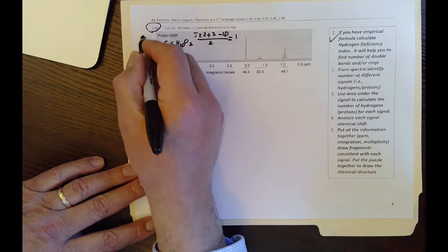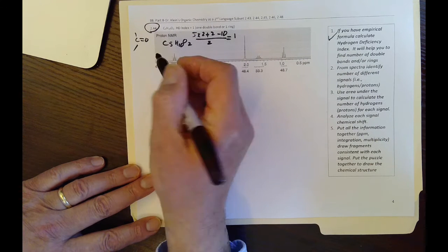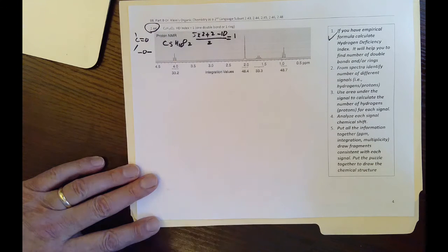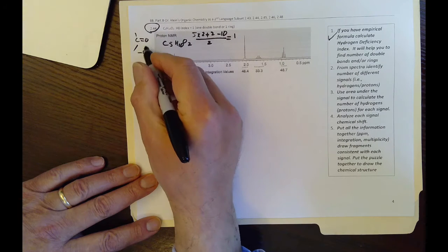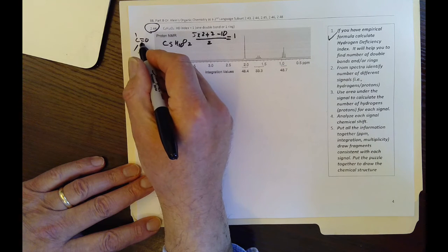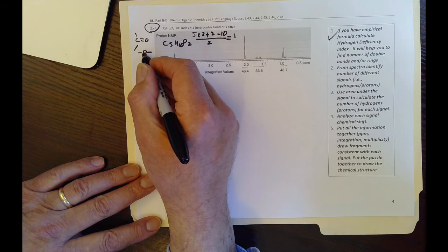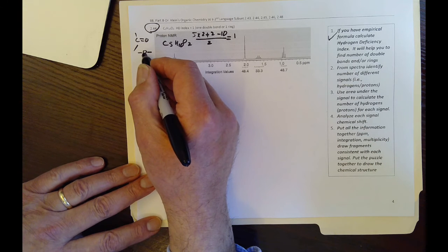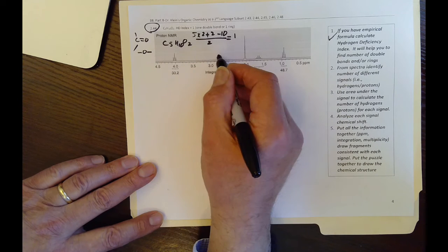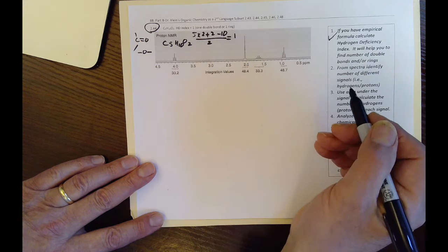So there's a good chance that would be a C double bond O, like the previous example, but we have an additional O. So that should help us find what the structure is. We have a double bond, and we have an additional O. As we know, these influence the ppm, and also don't have any hydrogen to contribute to the spectra. So the spectra doesn't show any oxygen. We have to remember that.